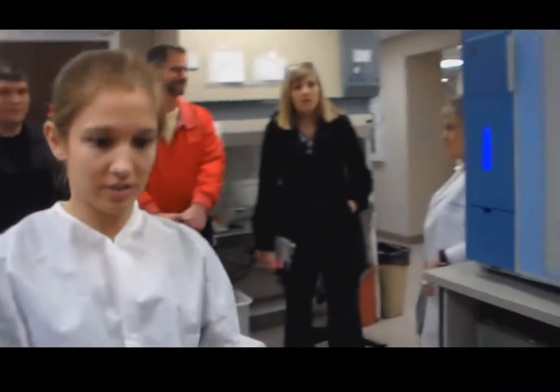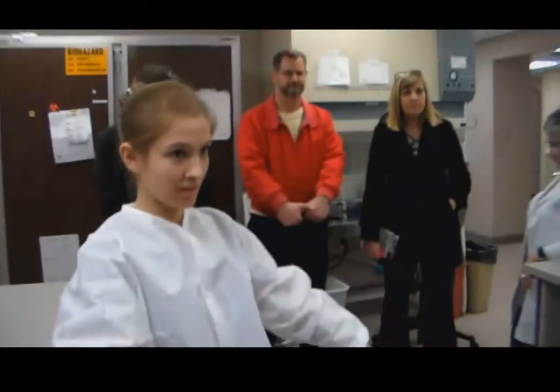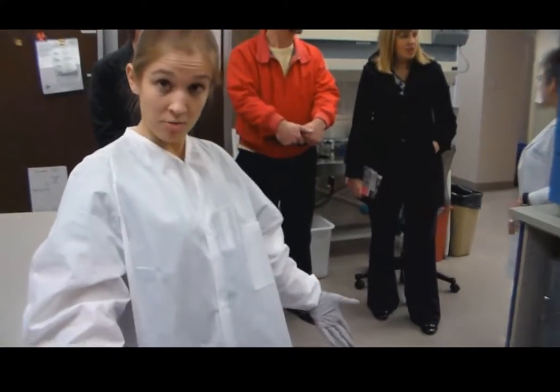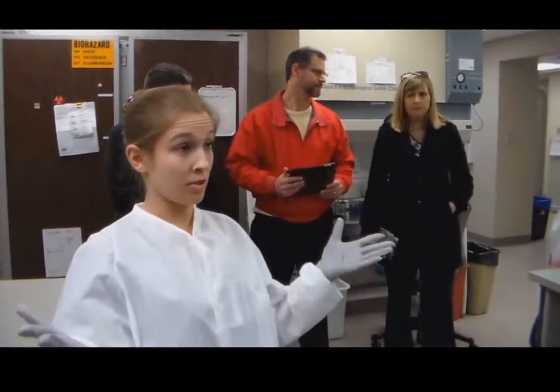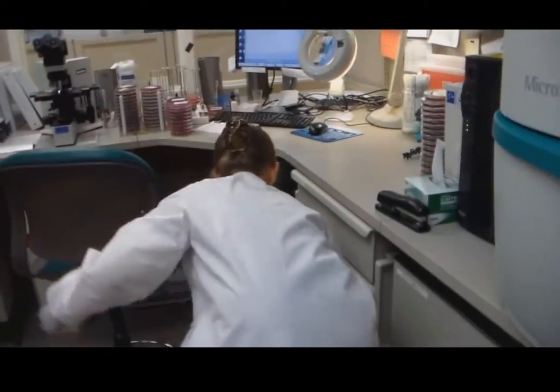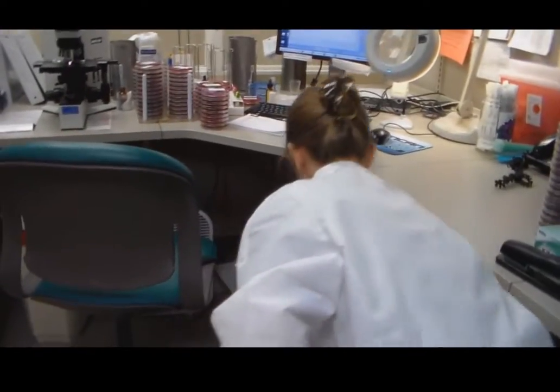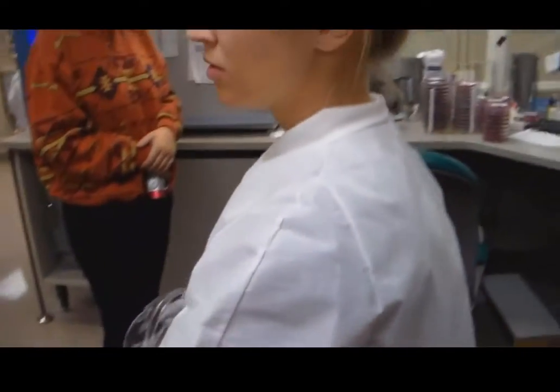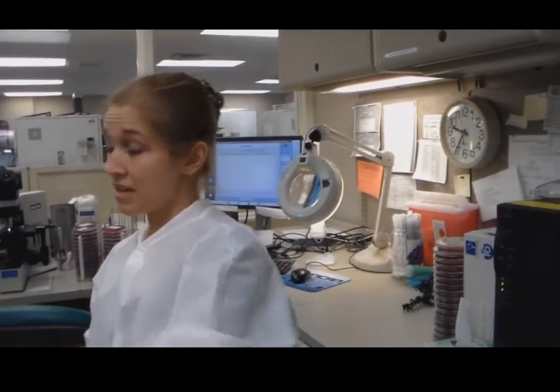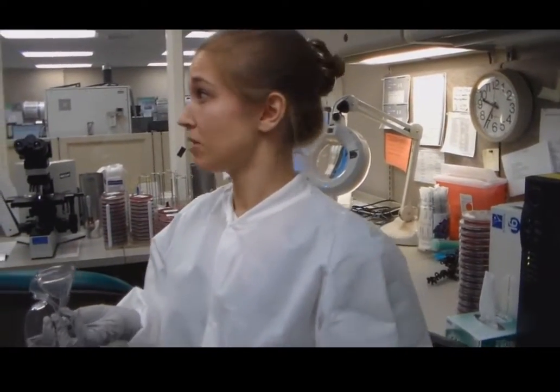I see that you're really covered up, so what kind of safety precautions do you take? The basic laboratory safety precautions that we take here are your lab jacket and your lab gloves. You always have to have closed-toed shoes and hair up. Those are the basic standards. For certain things we do have goggles. On this one, this is a biochemical reaction for the ID that we use. Whenever I'm working with this and I have it open, it has lots of chemicals that you use for the biochemical ID, so I would wear these goggles while I'm working with the chemicals.